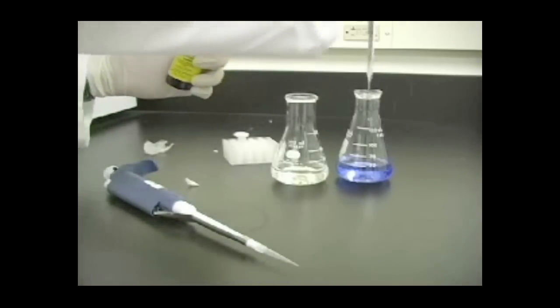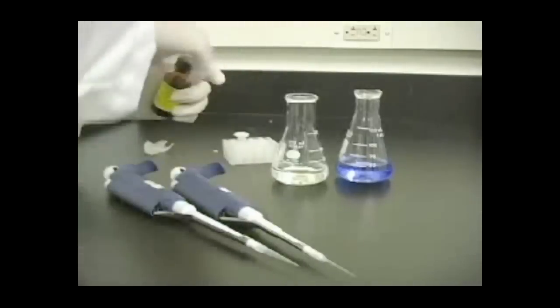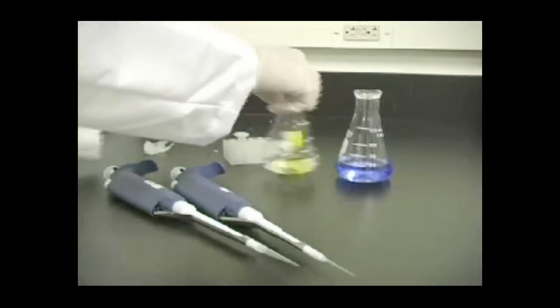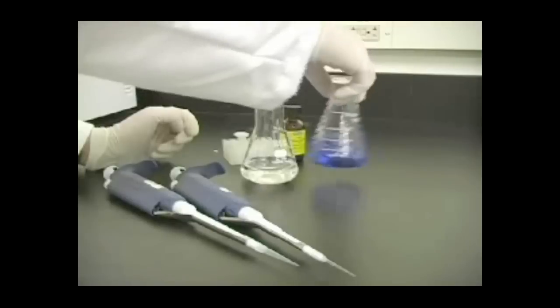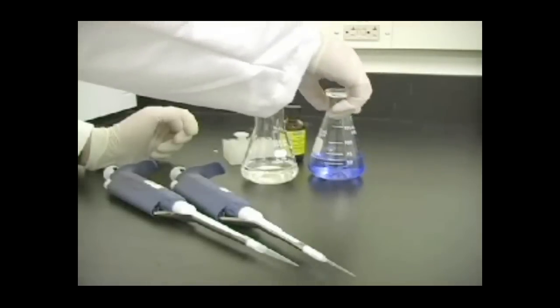Make sure to swirl the solutions to ensure the initiators are evenly incorporated into the monomer solution. You now have about 10 minutes to complete the rest of the casting before the acrylamide begins to polymerize.